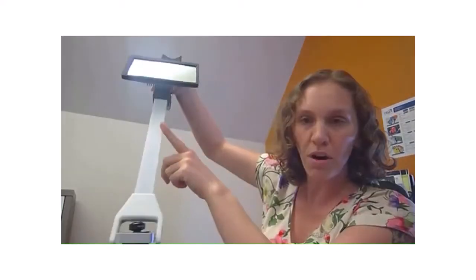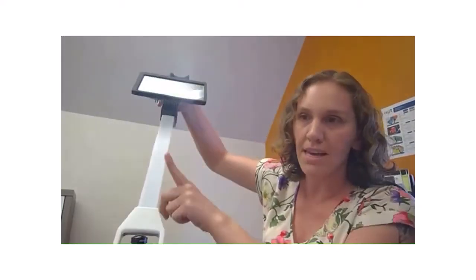Okay, here's the instrument itself. There's a nice armrest built in, a tablet that is firmly attached, allowing one-handed use, and as mentioned, the self-leveling lens, and 24 PAR sensors are included in the arm of the instrument. The instrument directly measures gap fraction analysis, PAR, or photosynthetically active radiation, sunflecks, and also the location and orientation of the instrument.